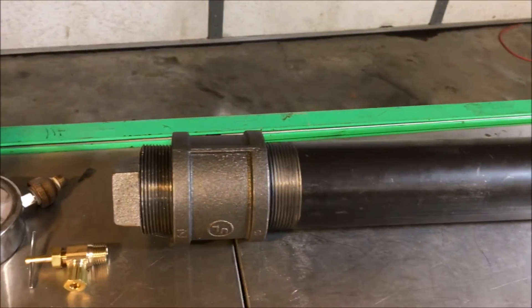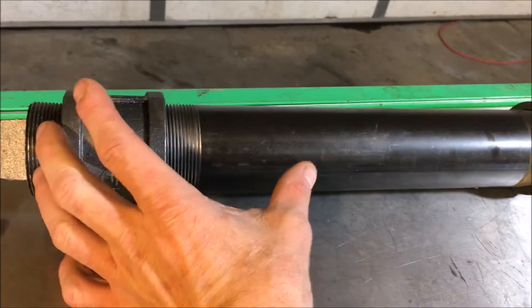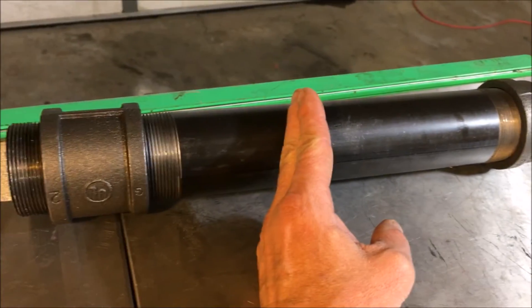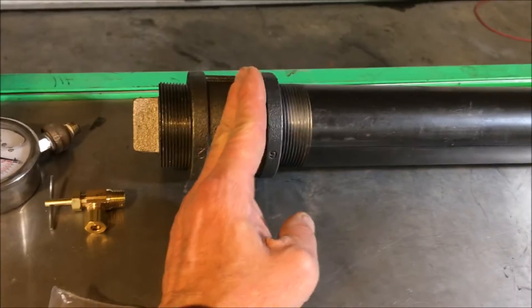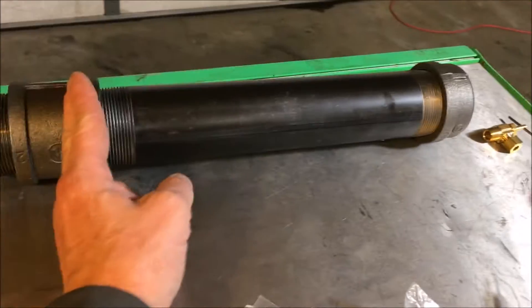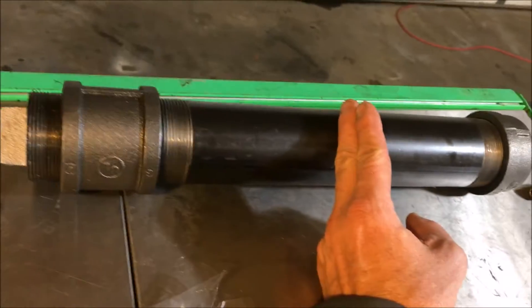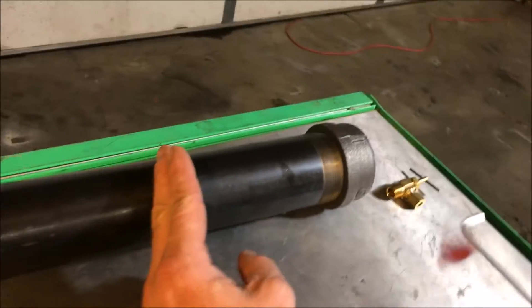I'm thinking this compression vessel could be dangerous if I don't do this right. We observed that massive explosion. When we start this out, we're going to have a column of fresh air in here. I'm going to possibly figure out a way to fill this thing all the way up with electrolyte — or at least up to a certain point — then cap it, let it pressure up a little bit, then tap the bottom valve and drain some of the caustic solution back out.